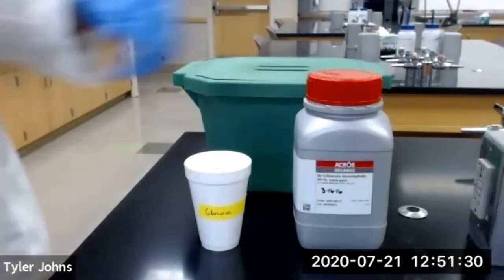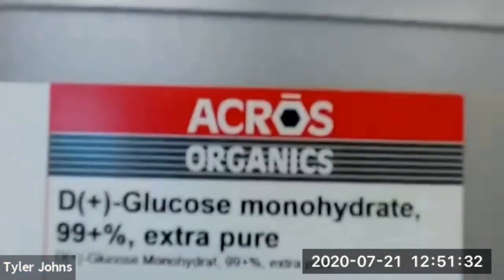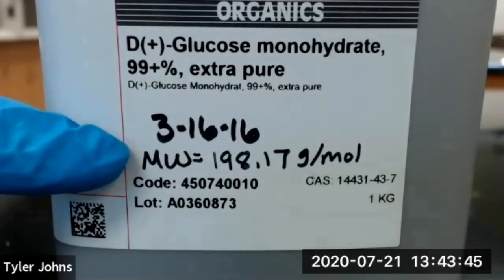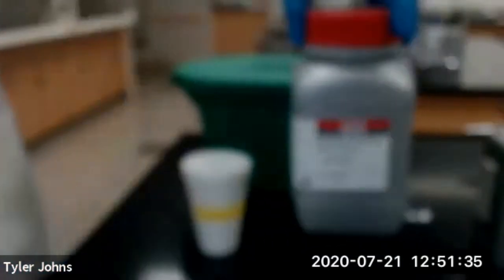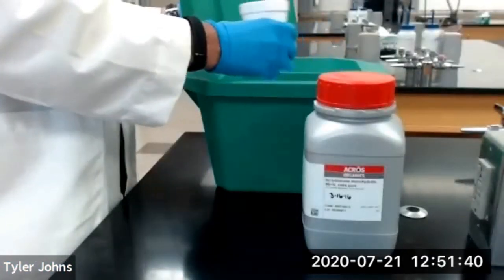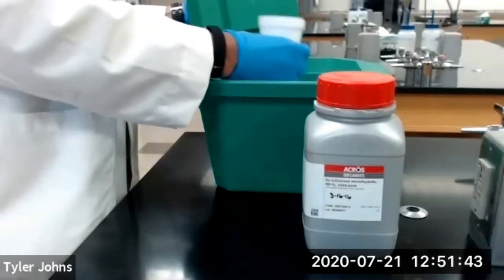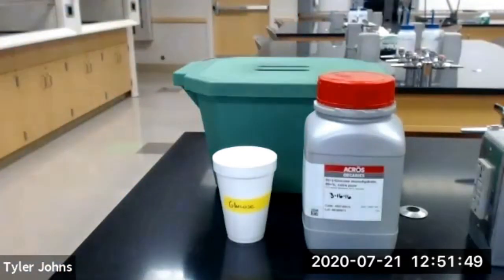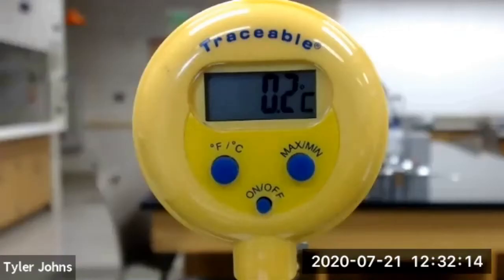We will now repeat the procedure using glucose as our chemical. The molecular weight of the glucose is 198.17 grams per mole. So we first need to fill our styrofoam cup halfway full with ice, and we need to record the initial temperature of the ice in our styrofoam cup. The initial temperature of the ice inside of our styrofoam cup is 0.2 degrees Celsius.